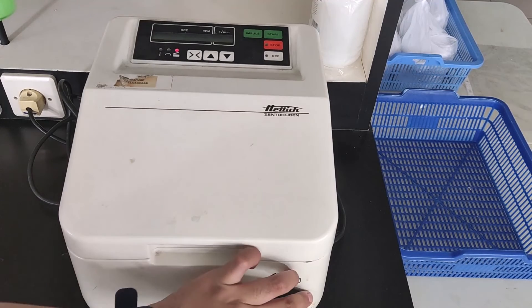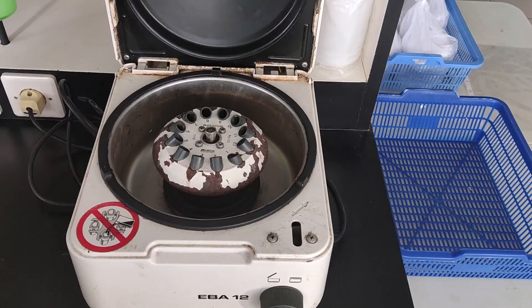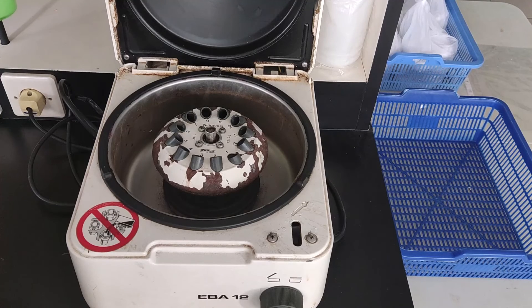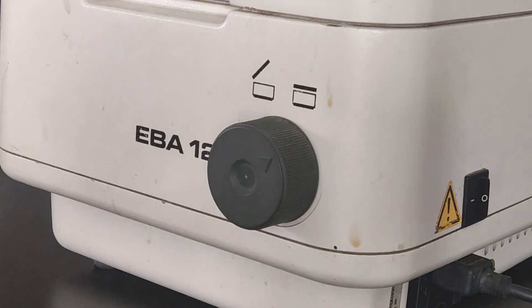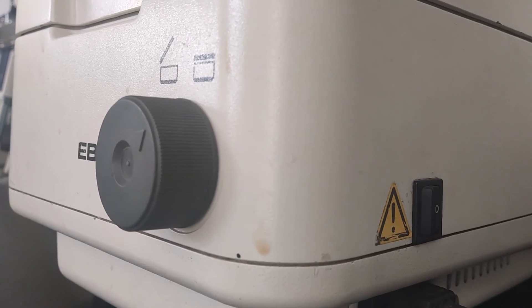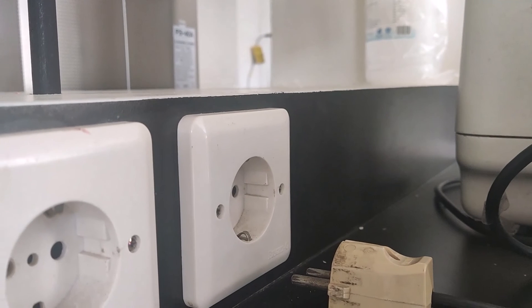After five minutes the centrifuge will stop and the lid indicator will turn on, meaning you can open the lid. Turn the knob, open the lid, and take the sample. After that, don't forget to close the lid again, turn the knob, turn off the centrifuge, and also don't forget to unplug the power cord. That's pretty much all of it — I hope this video helps you understand how to use the centrifuge.